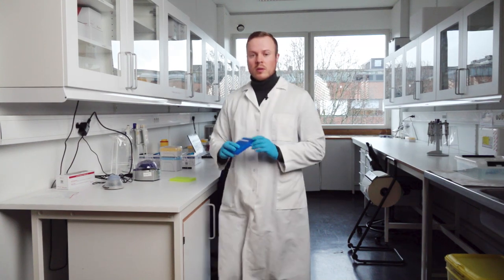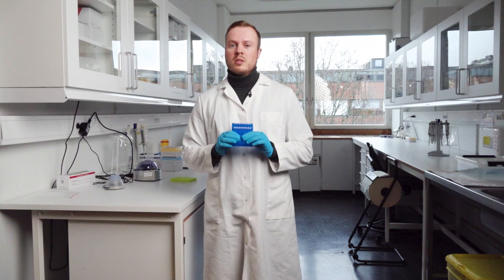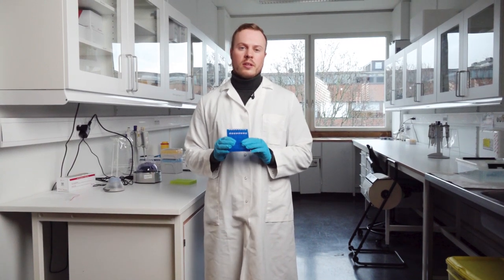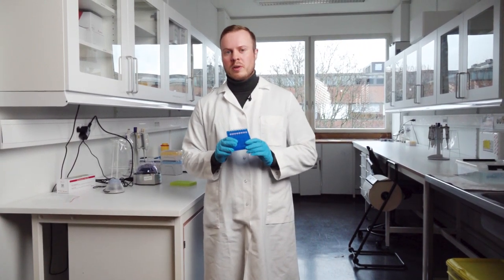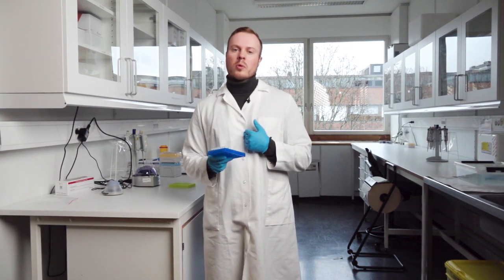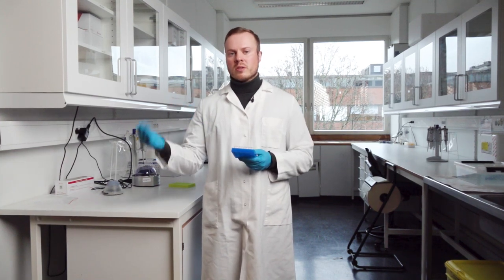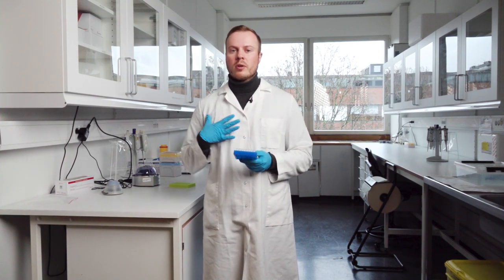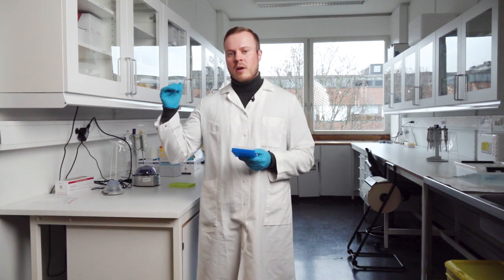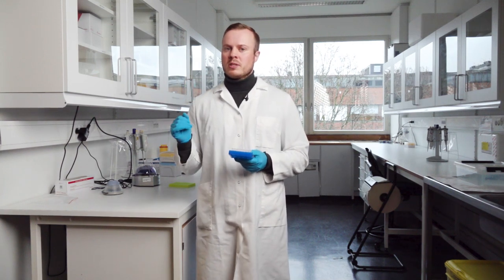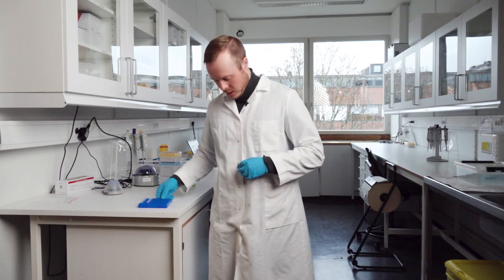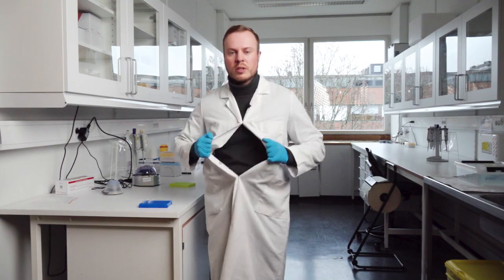Now I have mixed samples and the PCR reactions. And then I need to go into the lab where the PCR machine is. And before I do that, it's very important that you remove your coat, because now we are going into a room where PCR reactions happen. So it's a high risk of contamination. Therefore, this lab coat that are working in the pre-PCR room is not allowed in any of the other rooms. Then I take it off before I continue with the samples.